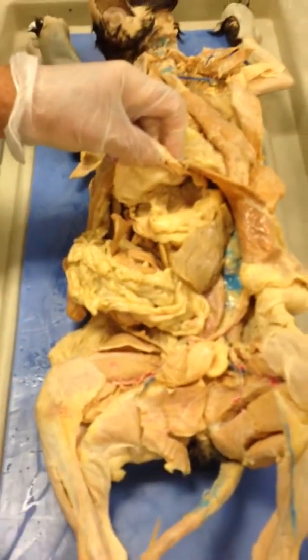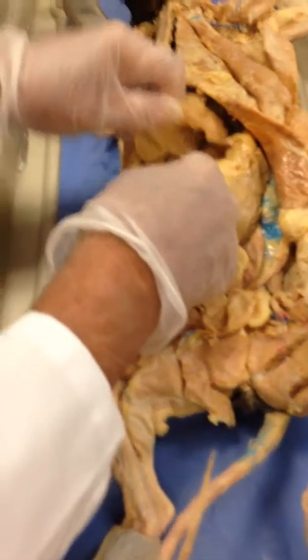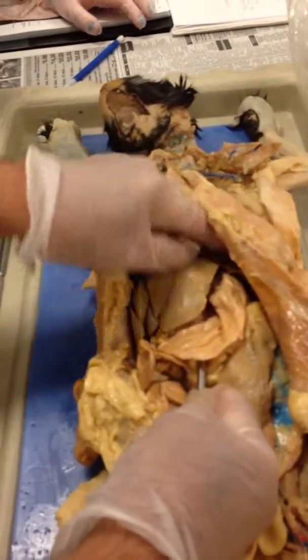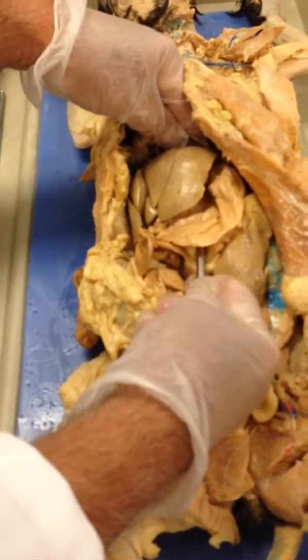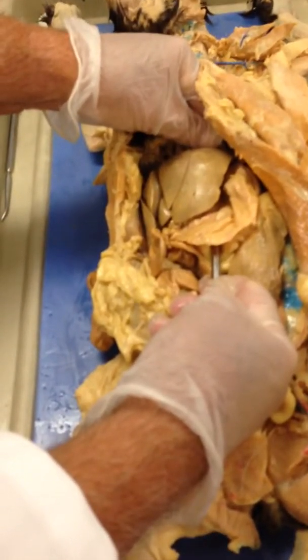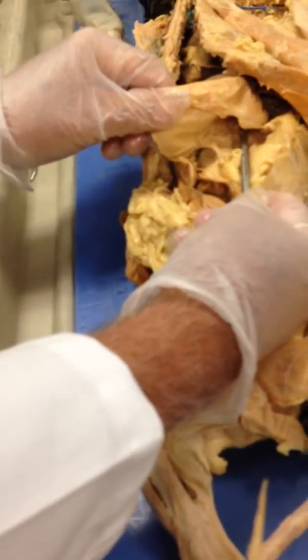Now, do you have a probe? If you stuck a probe, see that constriction up there? If I stick a probe through there, I should go up through the diaphragm. Put your finger right there where mine is and see if you can feel it. Can you feel that probe? Okay, what does that tell you? I went through the diaphragm and now I'm up in the esophagus. So I passed through the esophageal hiatus, that little hole where the esophagus passes through the diaphragm. And you know that's where I am because you felt the probe up there in the esophagus.